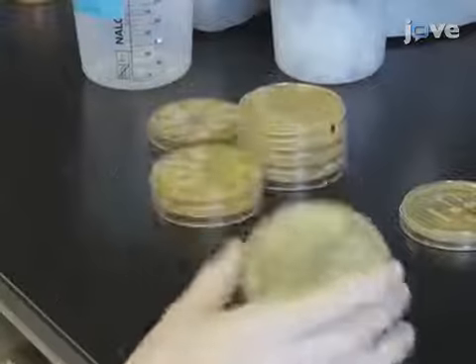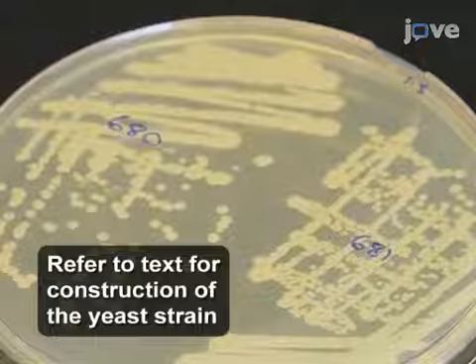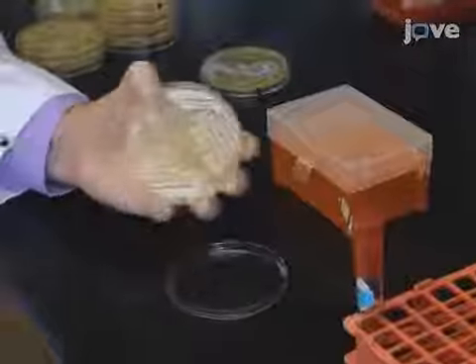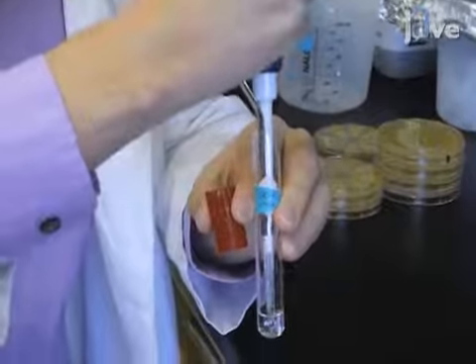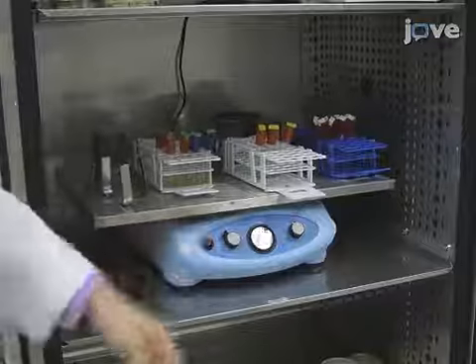The yeast cells used in this experiment have been constructed to constitutively express GFP-labeled tubulin. Inoculate about 1 microliter of yeast cells from a single colony on a plate in 3 milliliters of synthetic complete medium. Allow the cells to grow overnight at 30 degrees Celsius with shaking at 250 RPM.